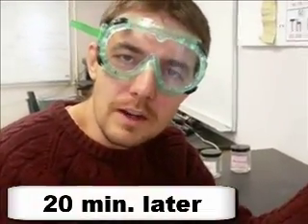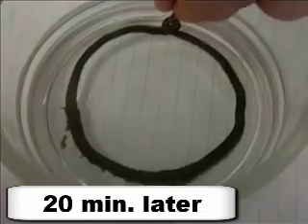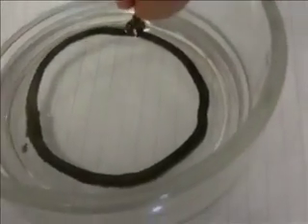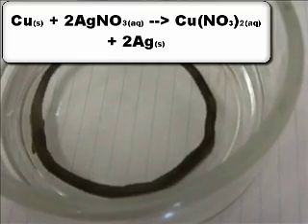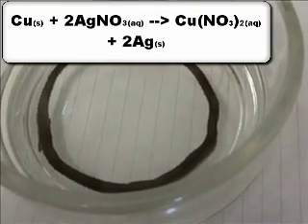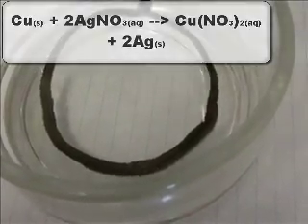All right, it's been about 20 minutes since we started our single replacement reaction. So let's take a look and see what we have here. So you can see that a lot of the silver that was dissolved in solution in that clear and colorless liquid came out of the solution. It replaced the copper. So what it did is some of the copper that was on the copper metal became copper ions. And then the silver ions in solution became silver metal in the single replacement reaction.